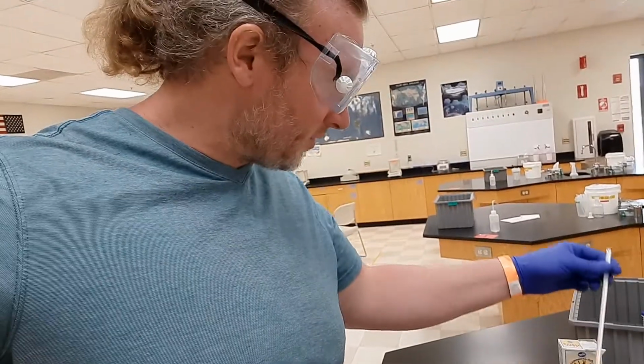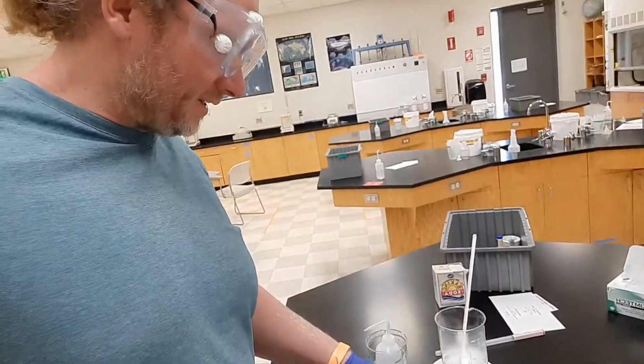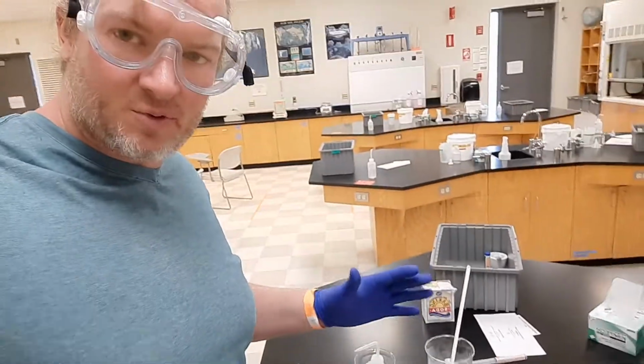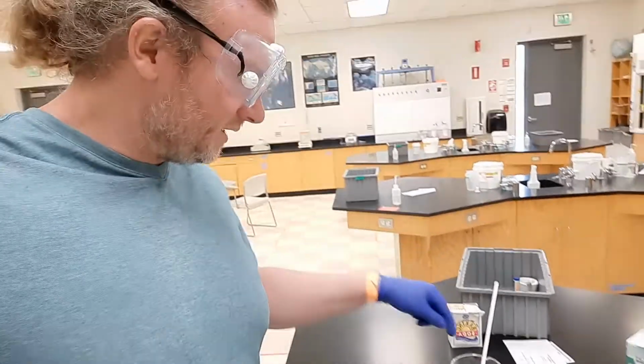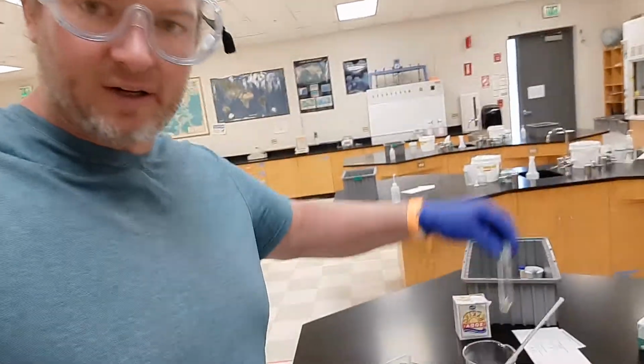Periodically I've just been looking at the thermometer. I'm not hounding this dial here, trying to make this thing exactly 70 degrees. As long as it's between 65 and 75, it's just been sitting there, and I've been probably picking it up every couple minutes just to kind of look at it.